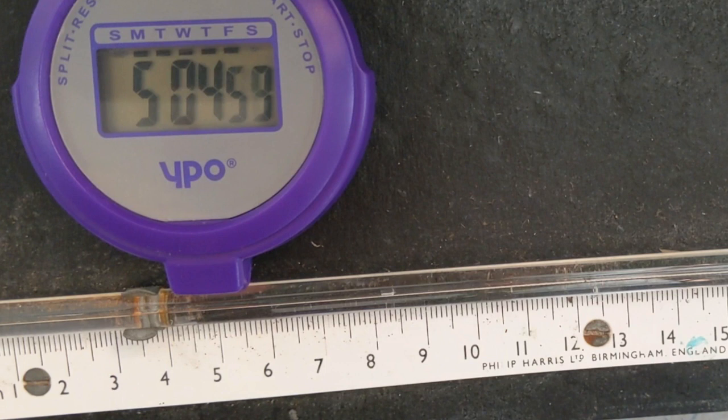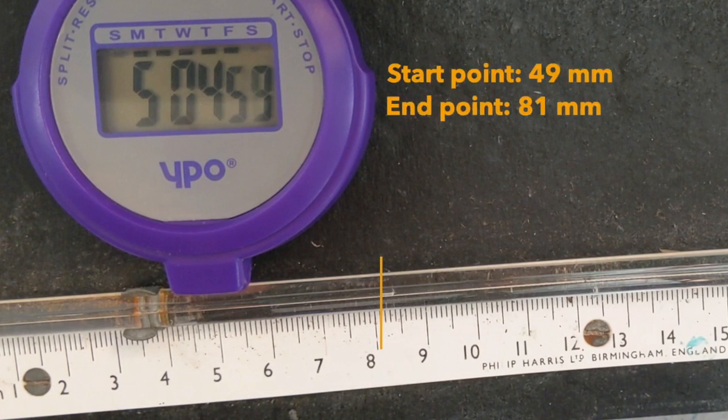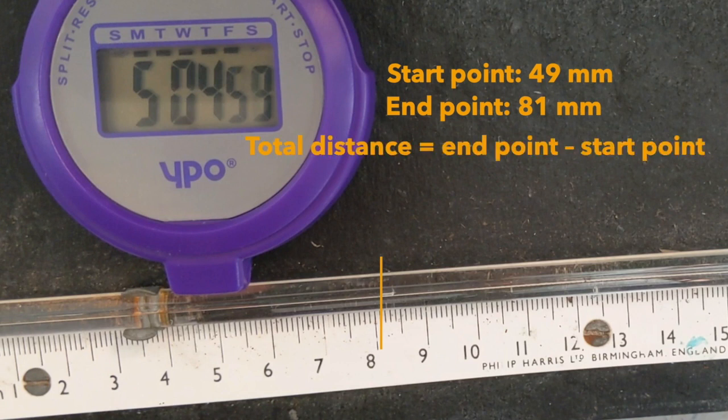The experiment was stopped after 5 minutes and the final position of the bubble was recorded. You can see here that the bubble reached 81mm along the ruler. Note that the position is measured from the same point on the bubble each time to ensure that the results are valid, and the smaller the bubble, the better. We can use the start and end points to calculate the distance travelled by the bubble over the 5-minute period. The start point was 49mm and the end point was 81mm. To find the total distance, you need to subtract the start point from the end point. So for this one, that is 81 minus 49, giving a total distance moved of 32mm.